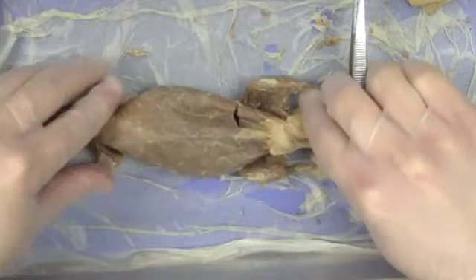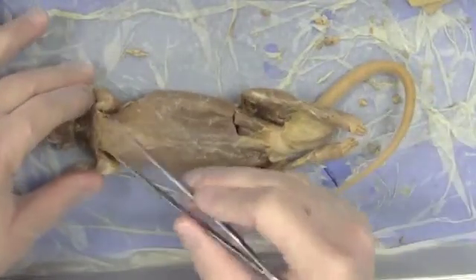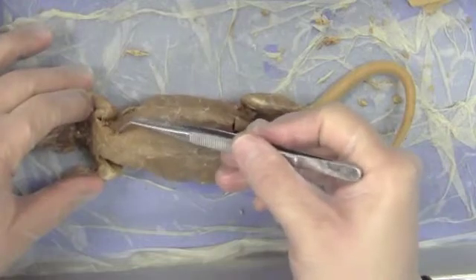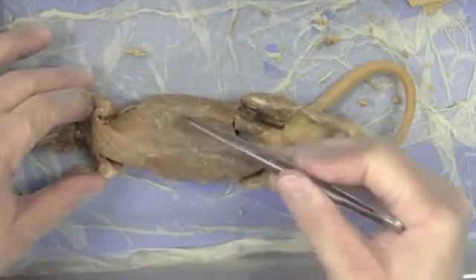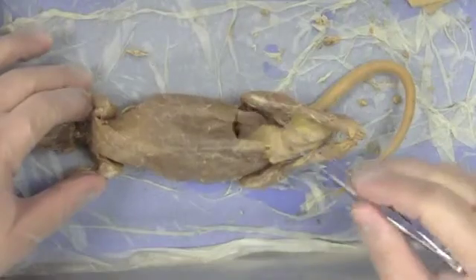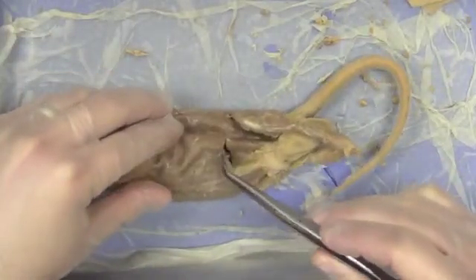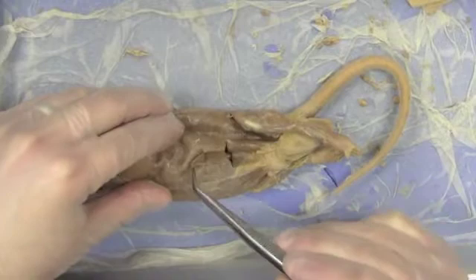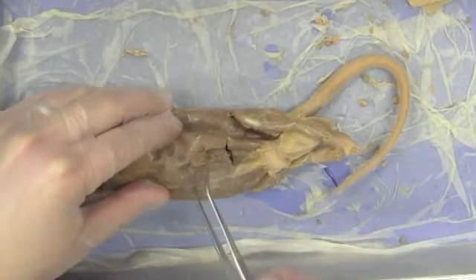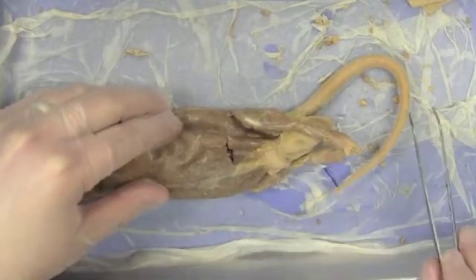Moving down into the abdominal area, we can follow the pectoralis down — this is the pectoralis profundus — all the way down to here. All of this stuff that makes up the abdominal wall actually has two layers, and if you're very careful you can separate out those two layers. I've actually been able to tease apart the two layers of the abdominal muscles.